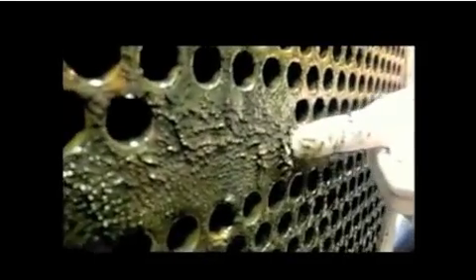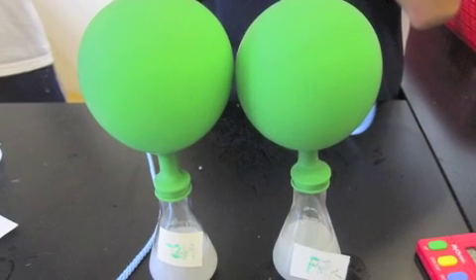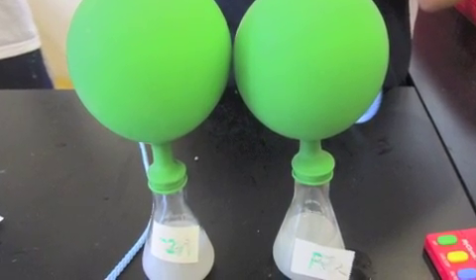Mole conversions were needed next to figure out how much of each of the reactants were used. After the experiment was done, a conversion was done to find the volume of the balloon and to next find the percent yield on how much was calculated and how much hydrogen gas was supposed to be created.